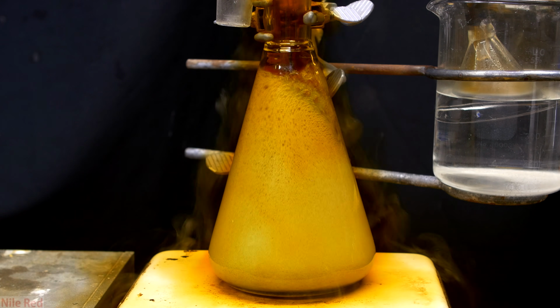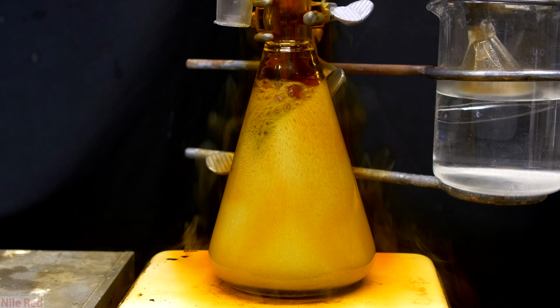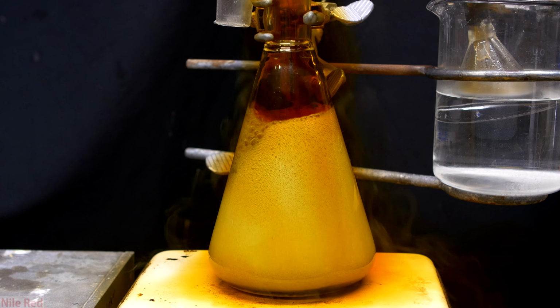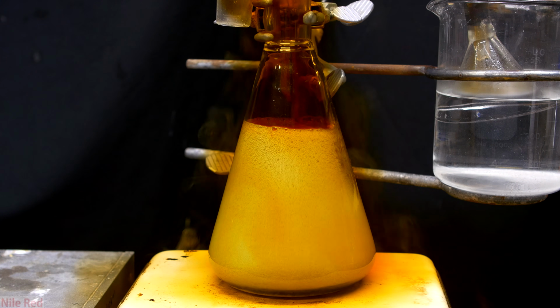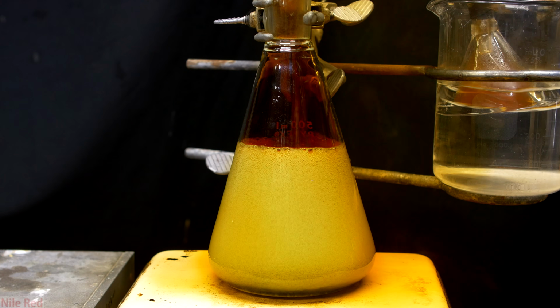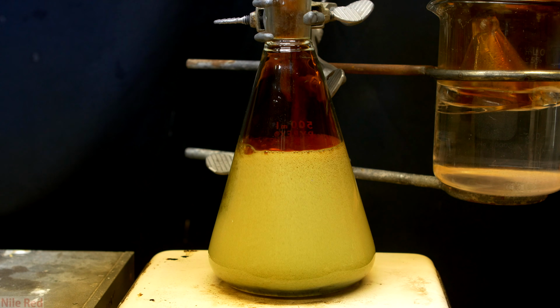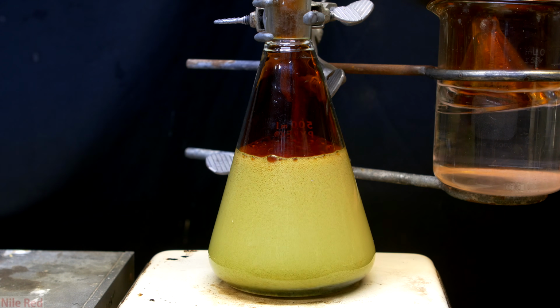For several seconds though, I was honestly really scared because you really don't want mercury nitrate all over your lab space. For me, I was lucky that the foaming died down before it overflowed, but it was nonetheless a pretty scary experience. The amount of nitrogen dioxide being produced is also way more than the trap can handle, so you can see that it's just basically being pumped into the air.